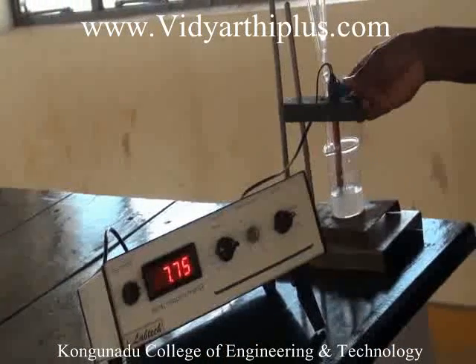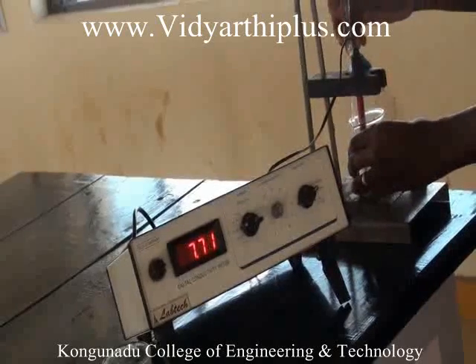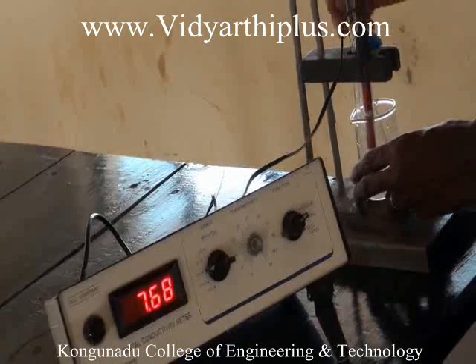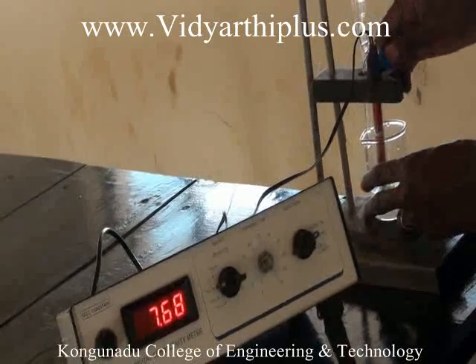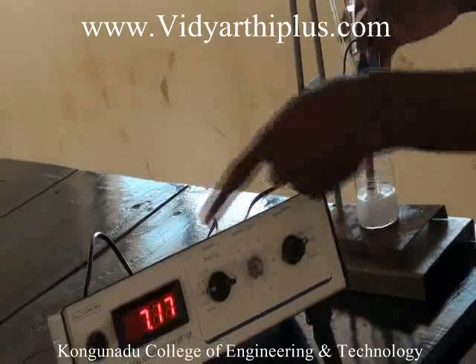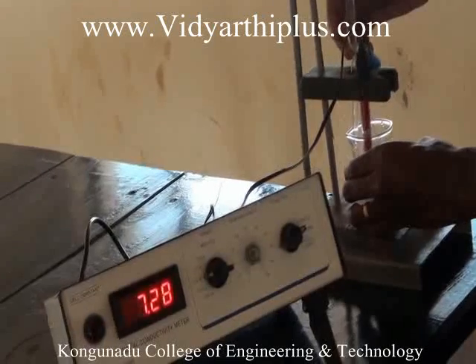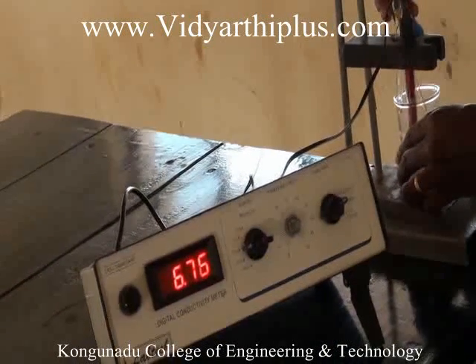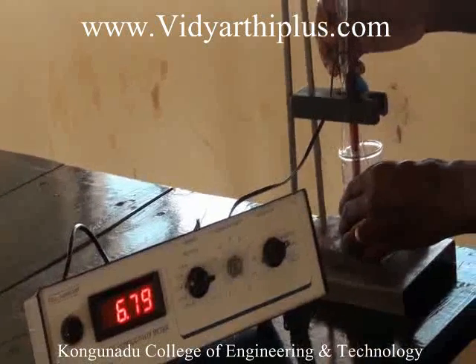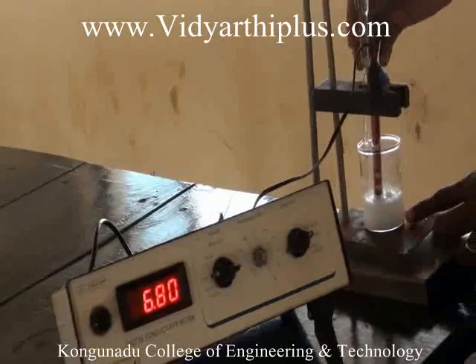After each addition of 1 ml of sodium sulfate from the burette, the titration is done and the values of conductance are noted from the conductivity meter. Now the barium chloride starts reacting with sodium sulfate. See the values of conductance decreasing, as shown on the digital conductivity meter. See the white precipitate formed in the beaker, which shows the neutralization of barium chloride with sodium sulfate.